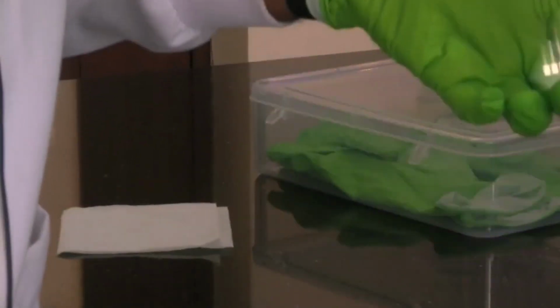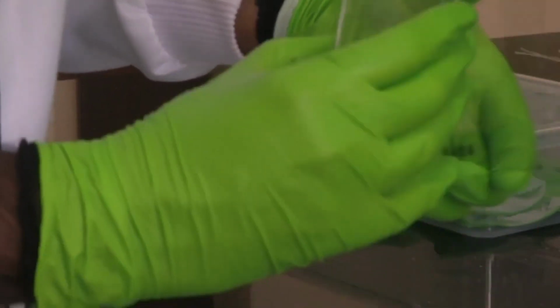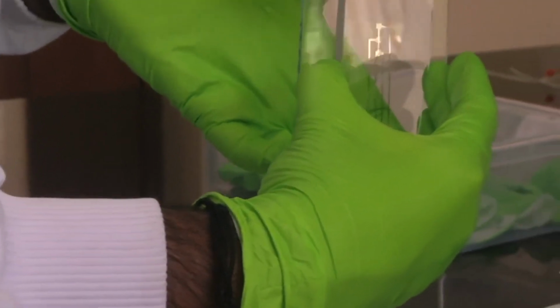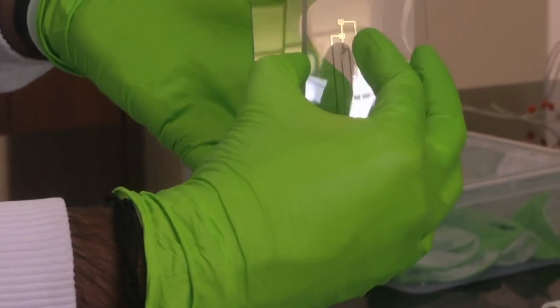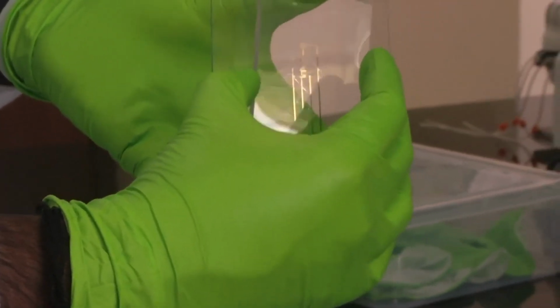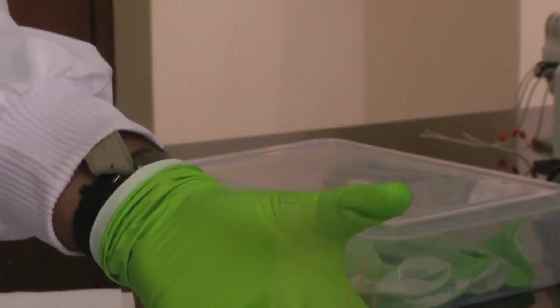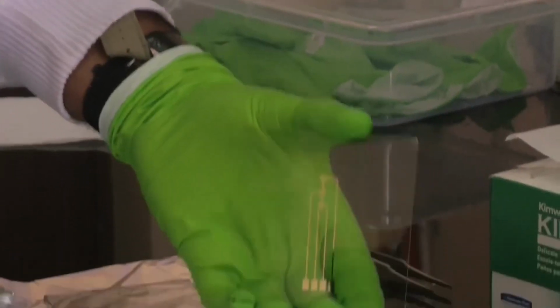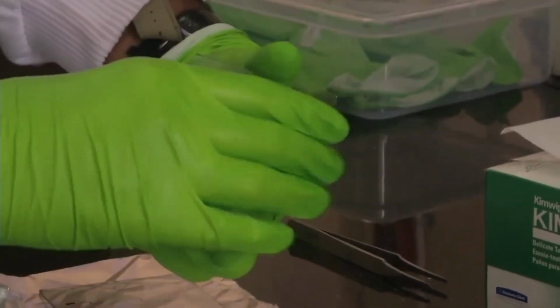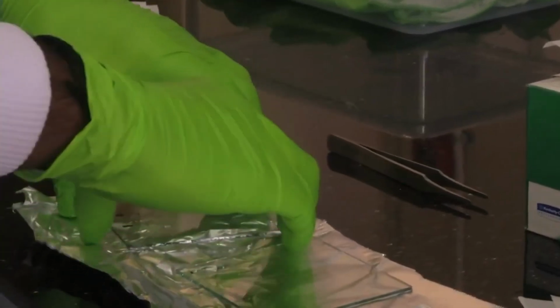On this gold electrode, you can bond your microfluidic channels. Make sure that you don't touch the device. So like this, you can bond your microfluidic channel with your electrodes, aligning your channel with the electrodes. Once that bonding is done, your device is ready. Especially a microfluidic device will be ready. How do we bond it? Bonding is done through a method called oxygen plasma. We are not going into the details of how that is done, but this is how bonding is done. Similarly, bonding can also be done to silicon wafer.